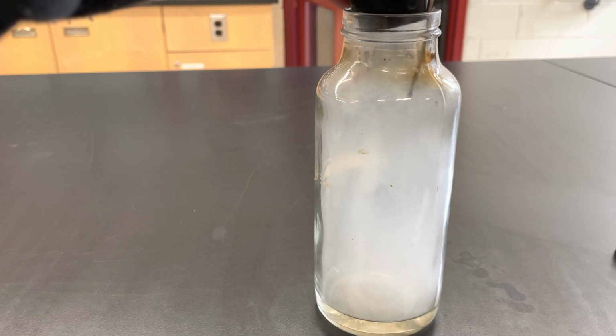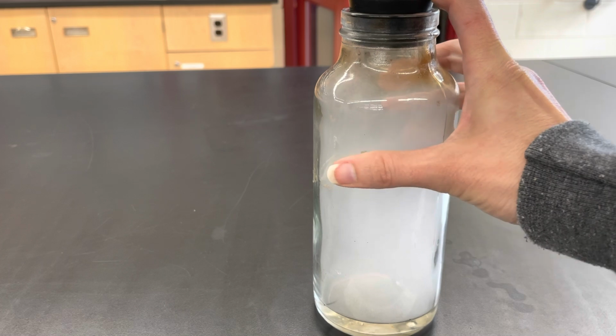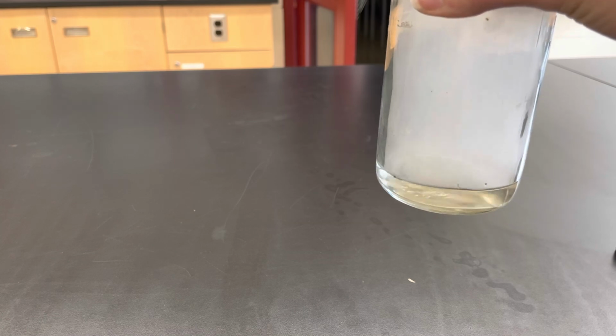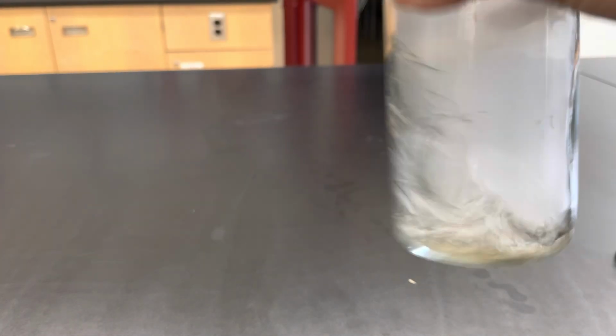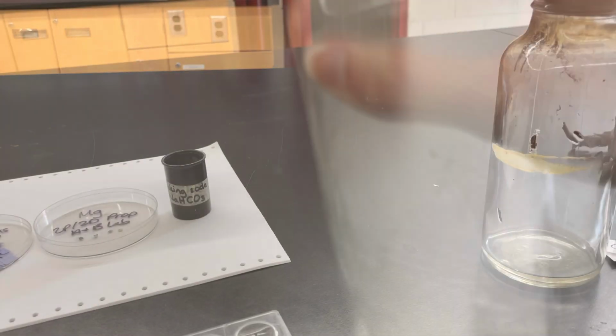So we can slip this out, and we have our gas trapped in there. Now we're going to mix that gas with the water in the bottom. A little bit of my stick dropped off, but that's okay. It's pretty hard to mix the liquid and the gas together, so you just keep shaking it around. The water is inevitably going to mix and react with the gas. We need those particles to collide together and make a reaction happen.